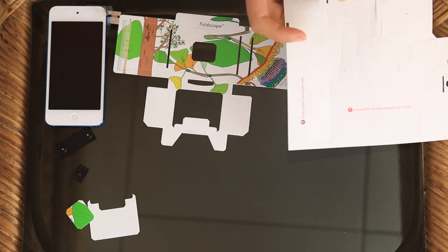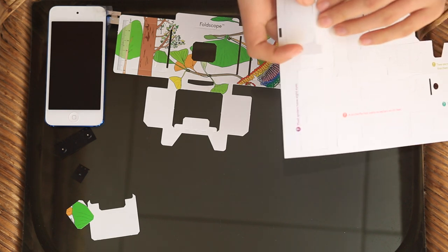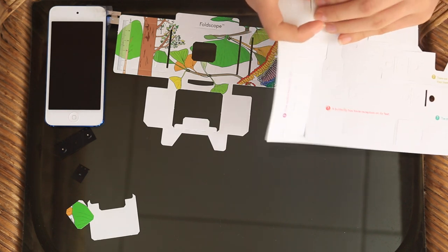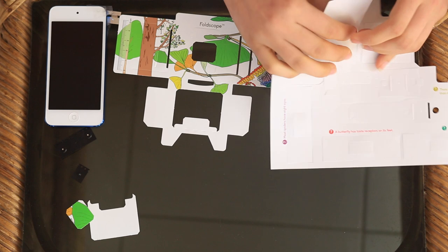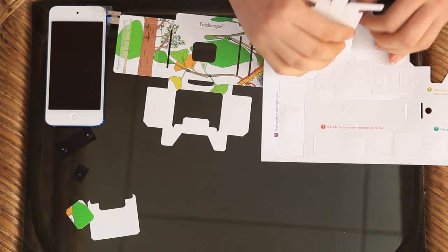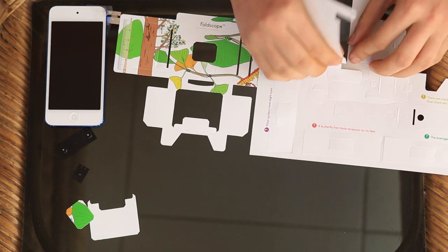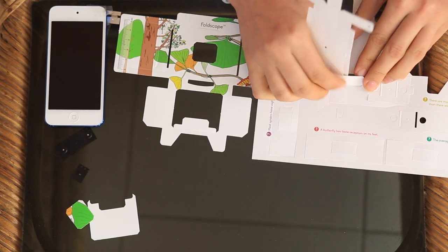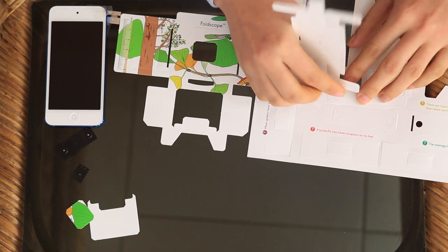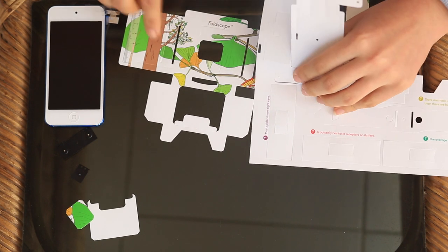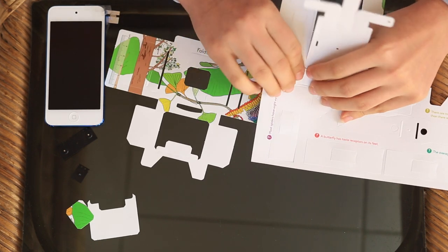Your light source can also just be sunlight or regular light outside. And it also holds the lens all the way over here. This is the part that moves inside of the panning stage.